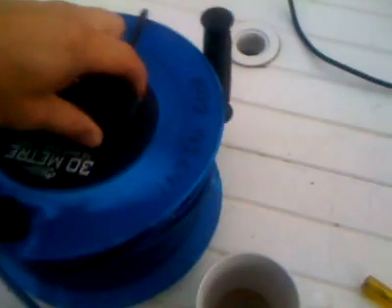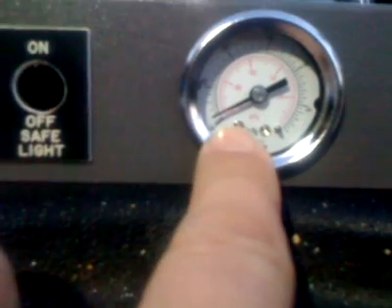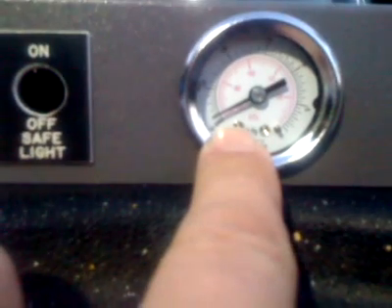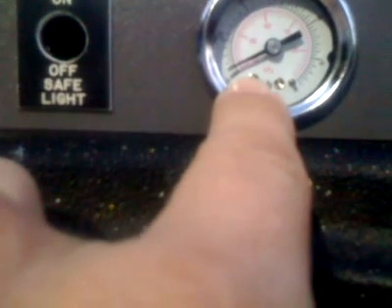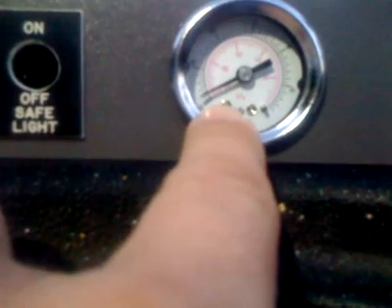Okay, so that's it. If I turn the compressor off, yank that puppy out, there we go, you'll see that we're getting such a good seal. This is very happily holding a vacuum, and I'll come back to that in a little while. That's just over 28.5 actually. That's very close to 29 inches mercury, which would explain why there are quite a few bubbles there now.